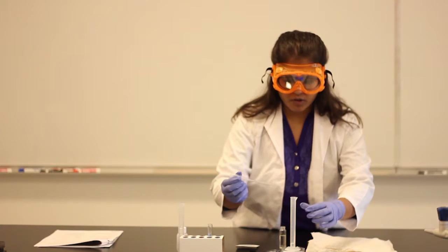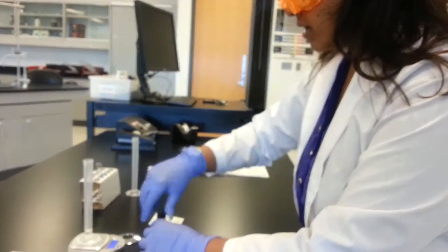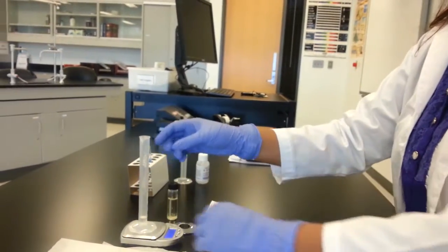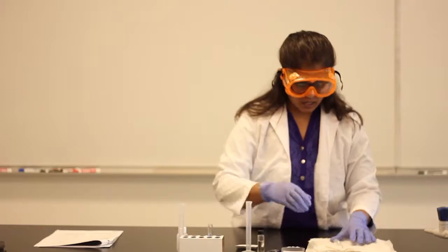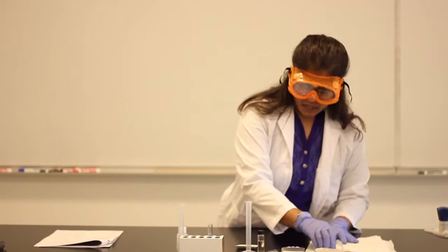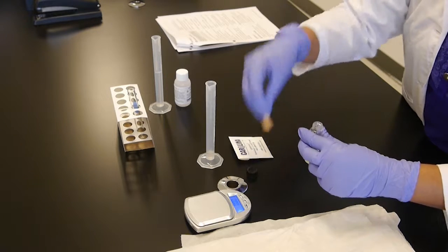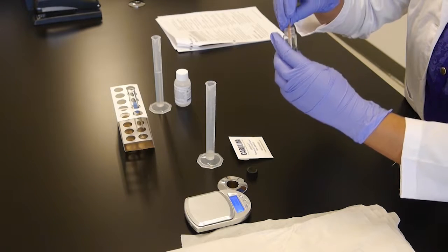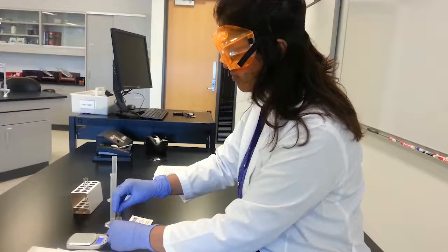So you know the volume. From the weighing balance, you can see the mass. So from there, you can easily calculate the density. So what was density again? Mass by volume. Now, let's see the pH of this biodiesel. So simply take a strip from the pH packet, and see if there's any color change or not. And make sure to write down your observation on the data table.